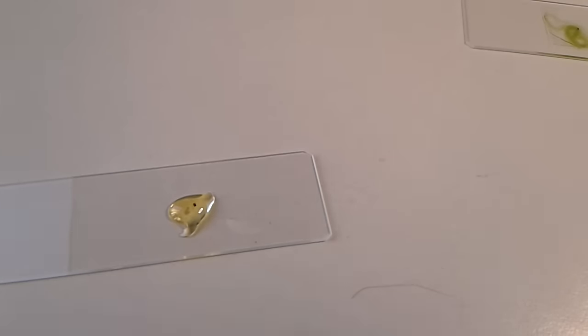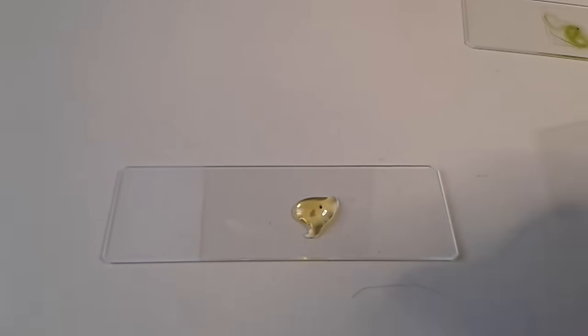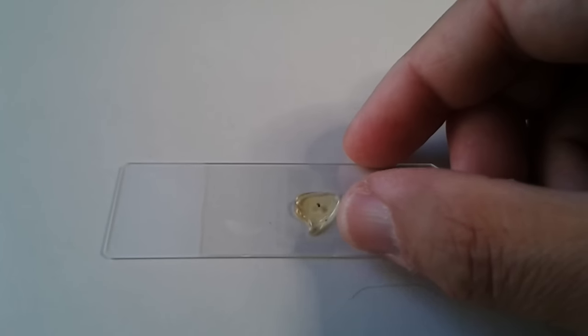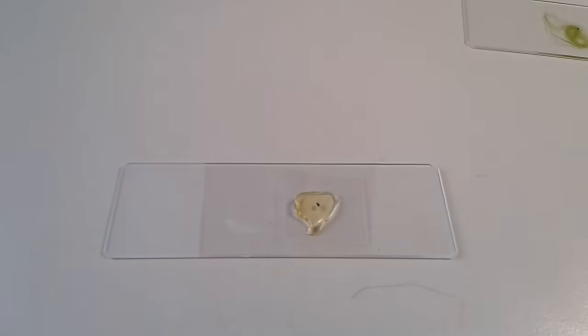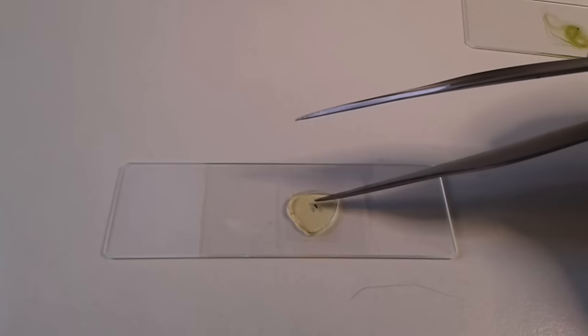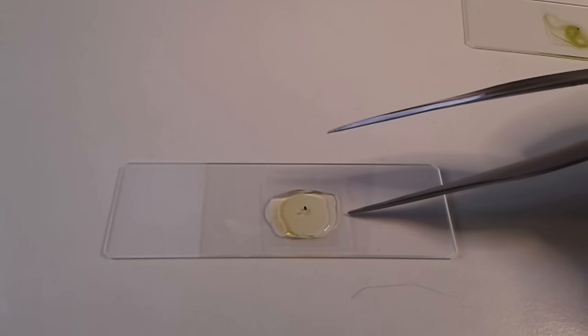One of the problems with this mounting medium is it's already very viscous, not as fluid anymore, so I have to add some more solvent to make it a little bit thinner. I'm going to add some isopropyl alcohol. That works quite well. I'm mounting this spider and I'm going to show you a picture later.